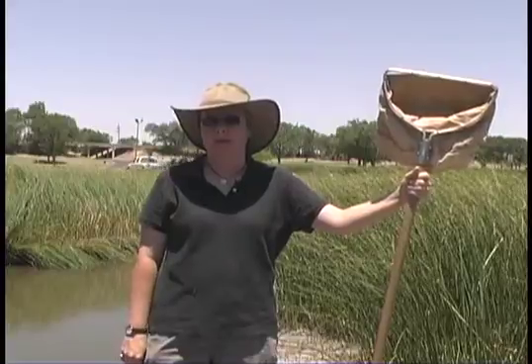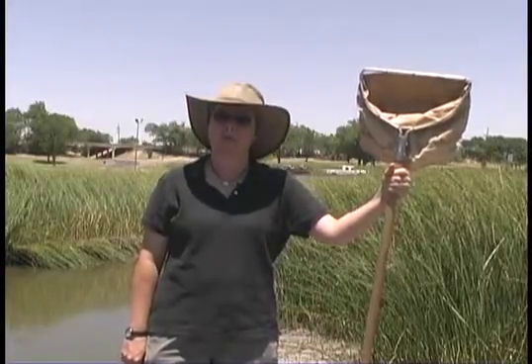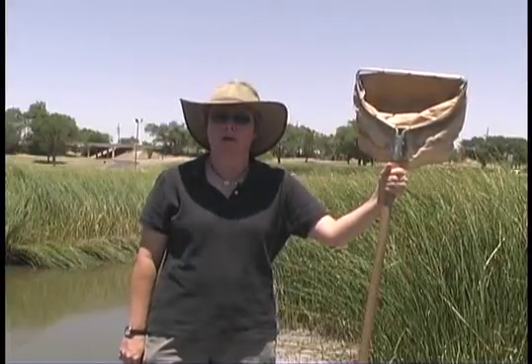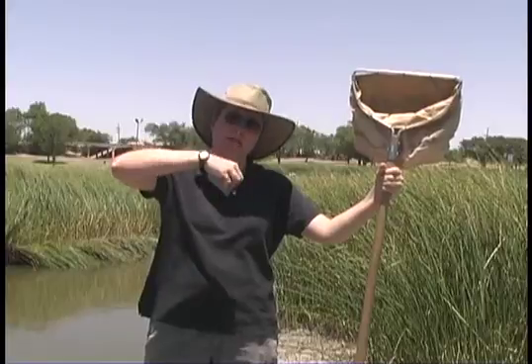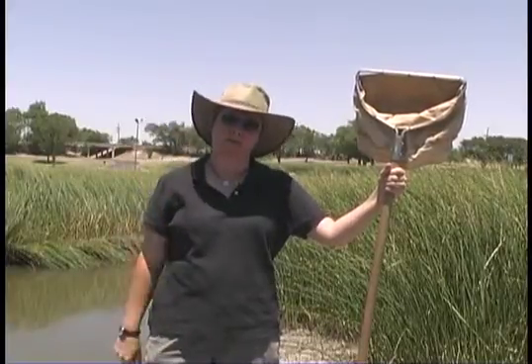The other thing you need to keep in mind is the depth of the body of water. We're going to be working with something that's quite shallow today. If you're working in something that requires a boat, there are different techniques you can use to sample the bottom. There are dredges, for example, that go down and take a bite out of the substrate and retrieve it back to the surface, and you can sort from there.